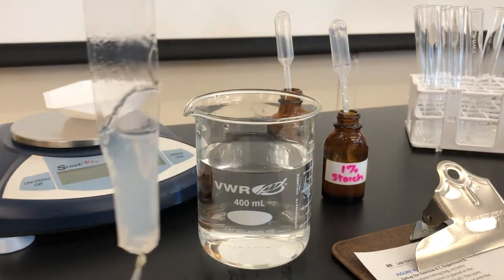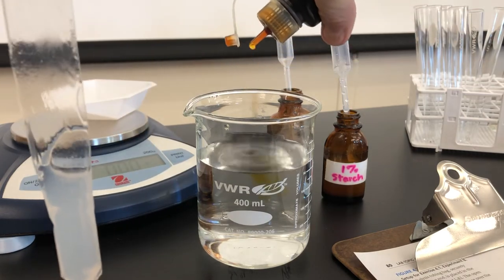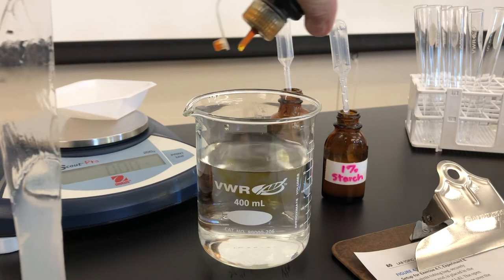To our beaker with distilled water, I'm going to add that iodine. And enough iodine to make it kind of a beautiful amber color.